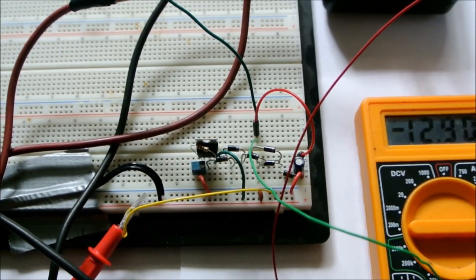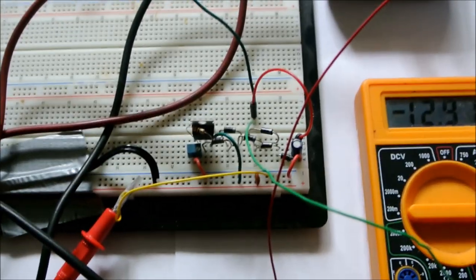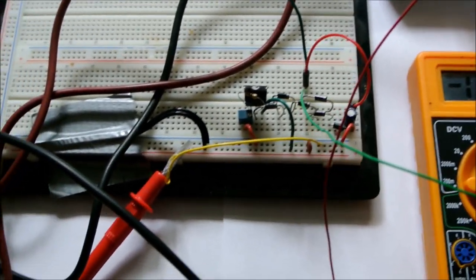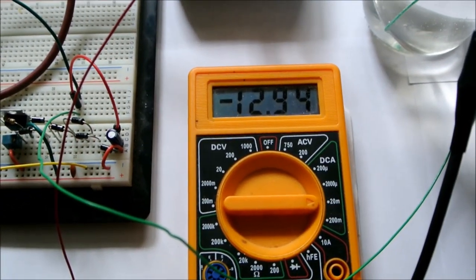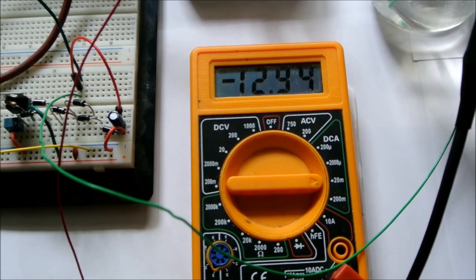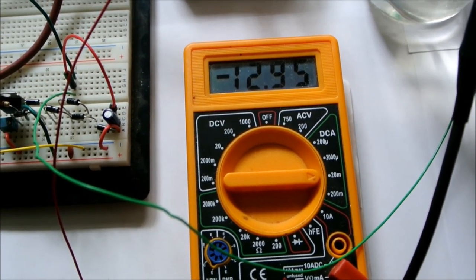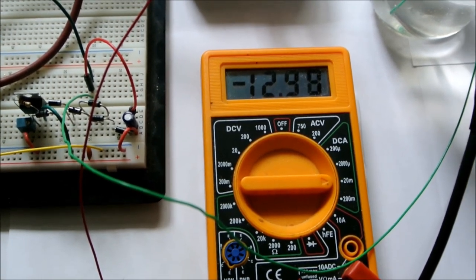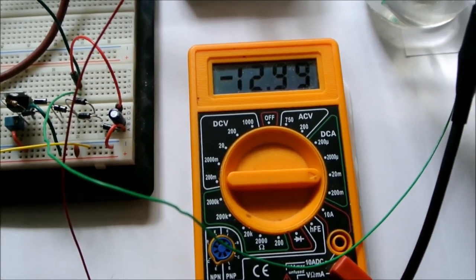Here's the final setup with the LM317 circuit powered and connected to the crystal growing electrolyte. The multimeter that is here is measuring the current, so it's about 13 milliamps, which is approximately where it should be, just very low current, definitely below 20 milliamps for the whole process.